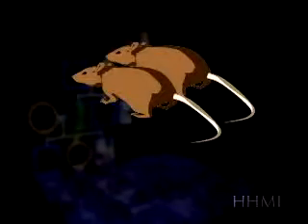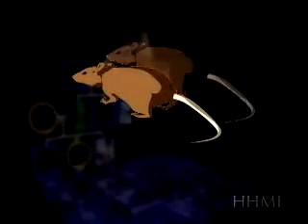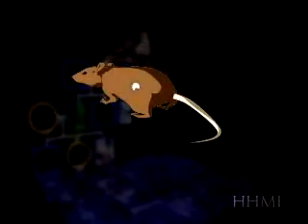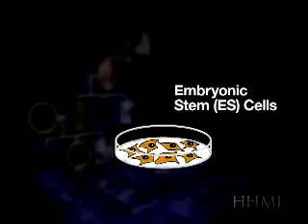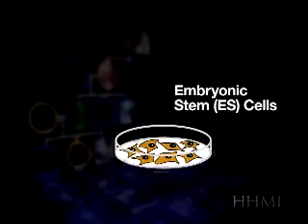In these methods, a pair of mice with brown fur are mated. Embryos are isolated from the mother after three days. At this stage of development, the embryo is called a blastocyst. Blastocysts can be cultured to make colonies of embryonic stem cells, or ES cells. ES cells have the potential to develop into any cell type or tissue.